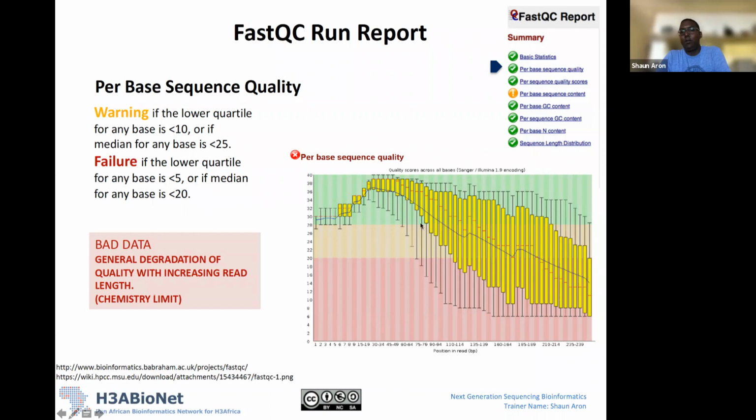because if you look at 20, you'll see that basically from about here, so that's about base pair position 112 to the end of the read, we have a lot of our reads just showing low quality. So basically for half of the read length, we have low quality calls. So this is something that's questionable.